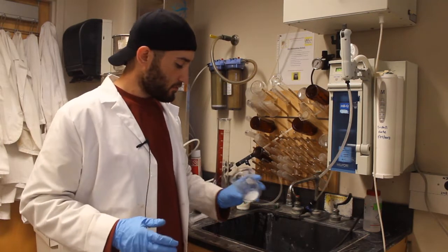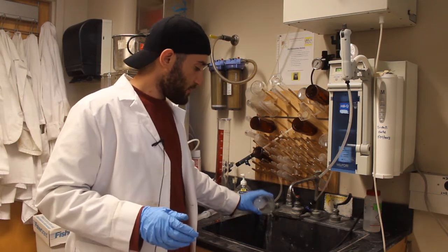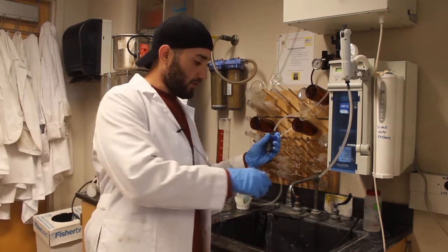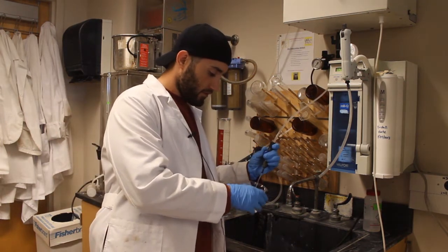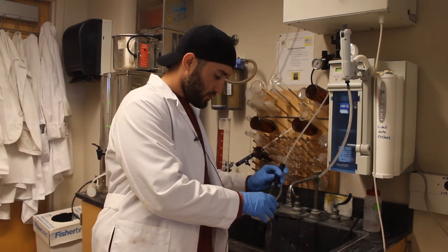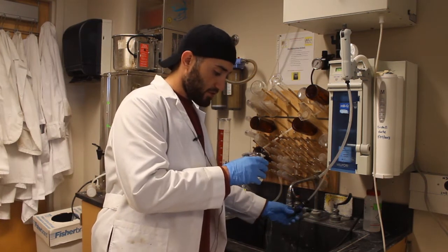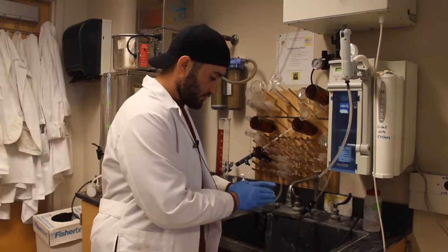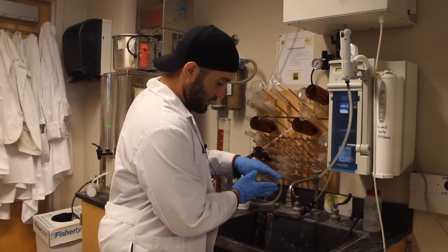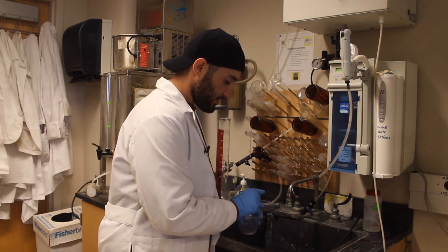We're here for our rinsing stage. So we're going to pour out the minimal excess ethanol that was from the cleaning process and take our deionized water line and flush it. Generally let this soak for just a little bit of time. And then I will drain off the excess liquid. And be careful to ensure that you remember what side was the membrane because at this stage it is a little bit difficult to tell.